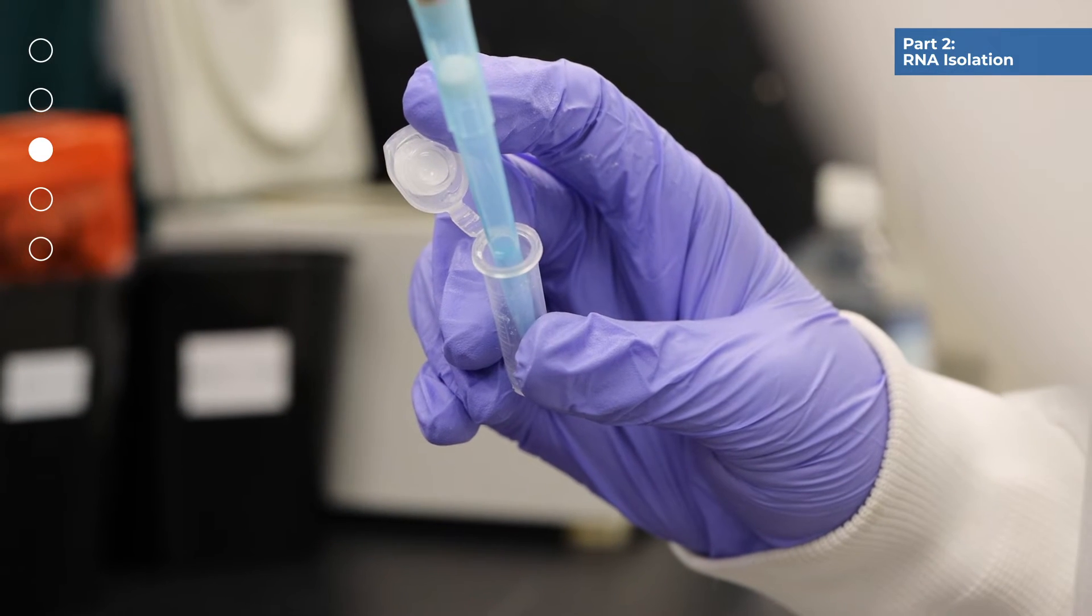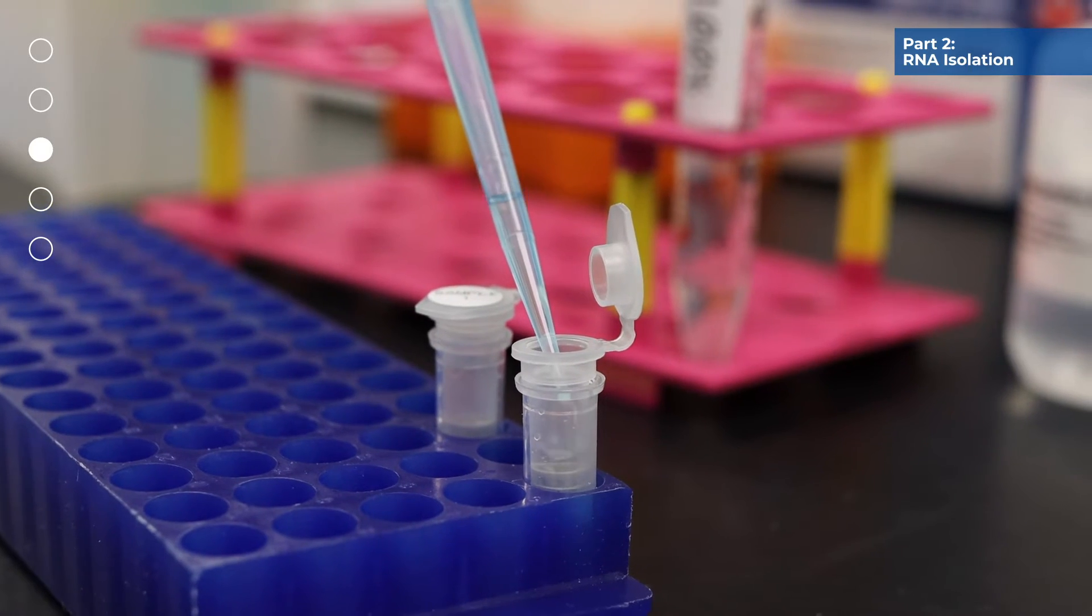Repeat step 4 one more time to transfer the remaining mixture from step 3 into the mini-spin column.